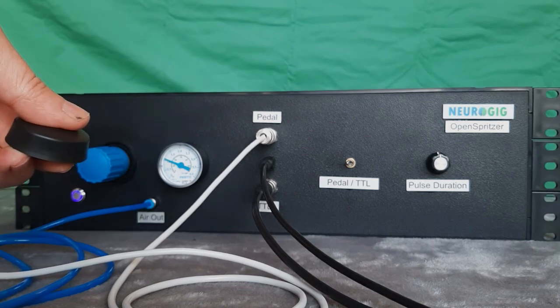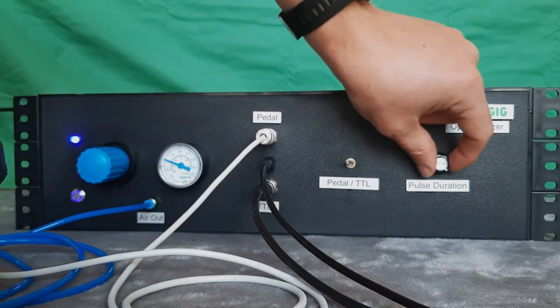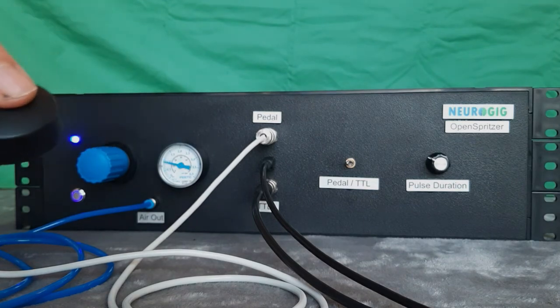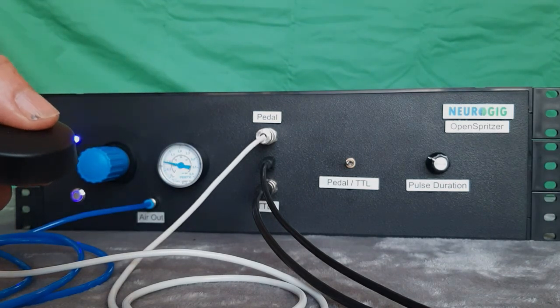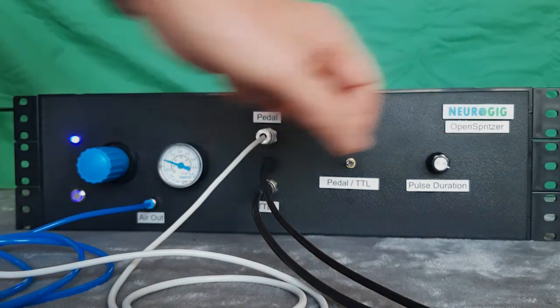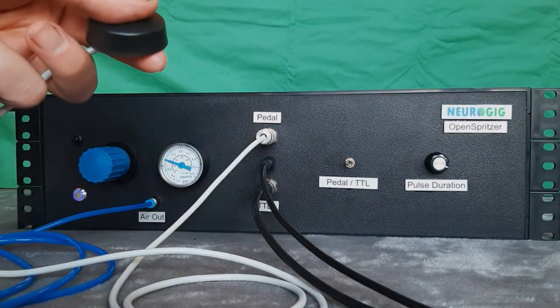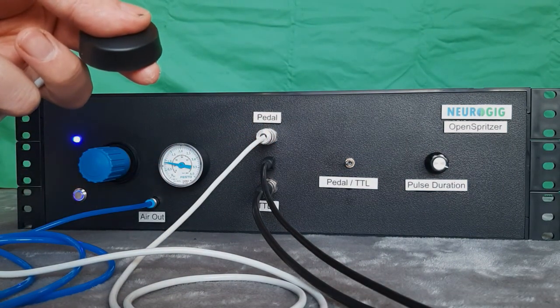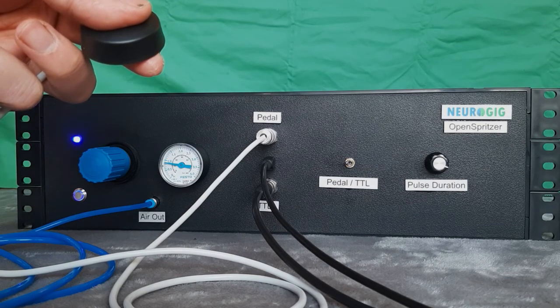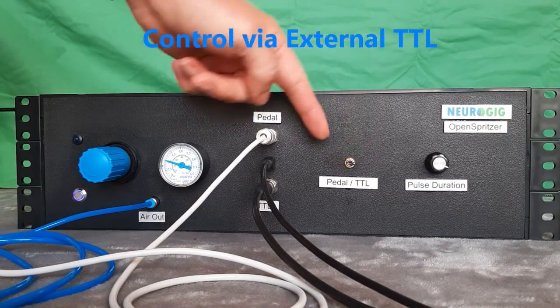So there's the shortest pulse, 100 milliseconds pulse. The longest pulse will now be 2 seconds. And we've changed the delay as well to 500 milliseconds. So if I hold in, we'll get that delay. Let's now switch from the pedal to the external trigger control.